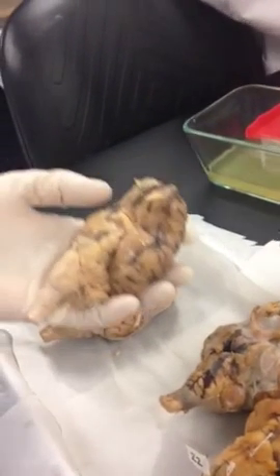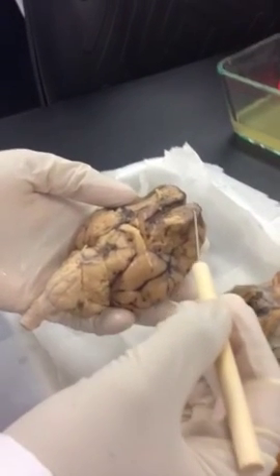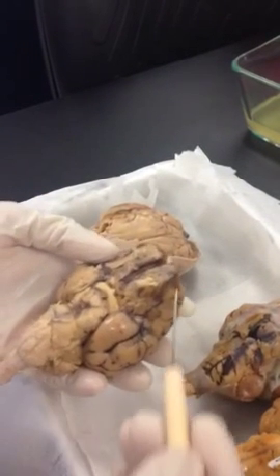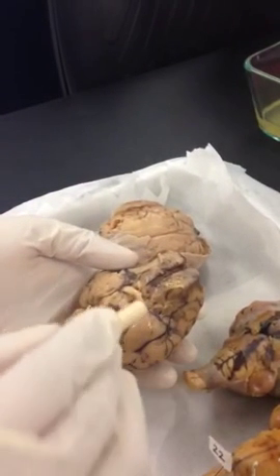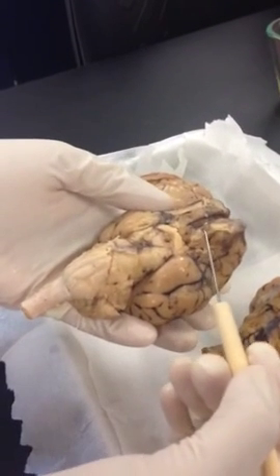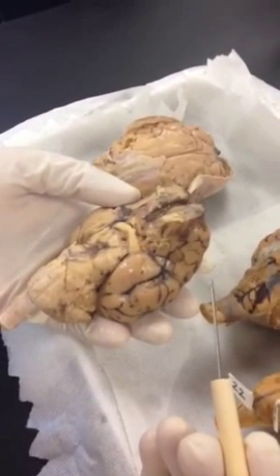So now you can match the picture in your book with this view. So what do we have? You see 2 projections here up in the front. This is the inferior view of the brain. These are your olfactory nerves, but the projection here they call olfactory bulb. Can you see that? Can you match with your picture in the book, please? The path of the nerve they call olfactory tract. Can we see that, everybody?